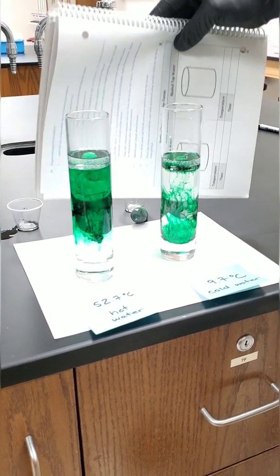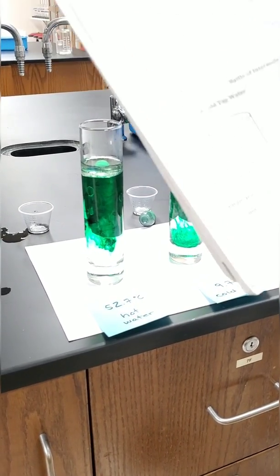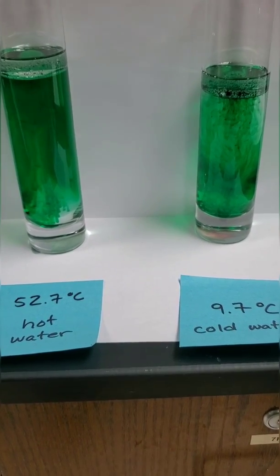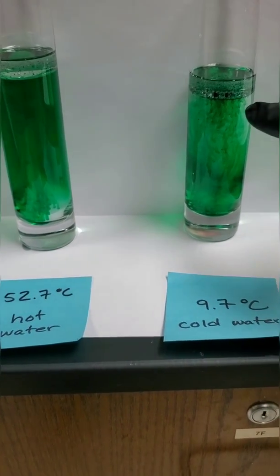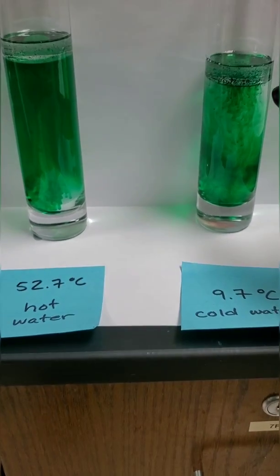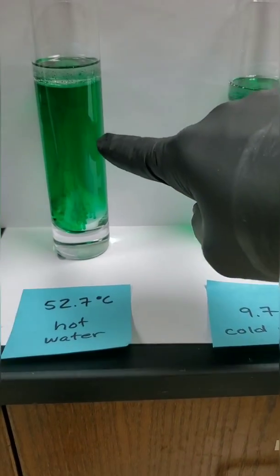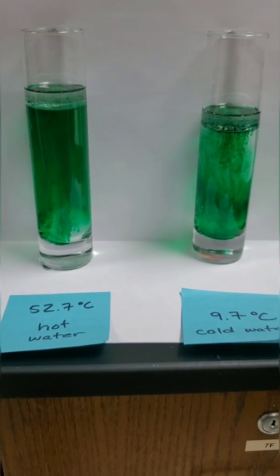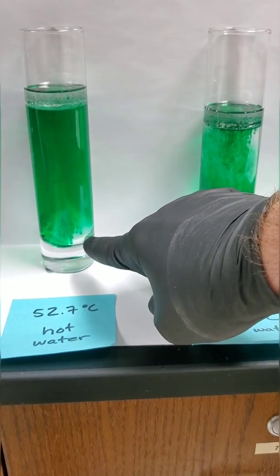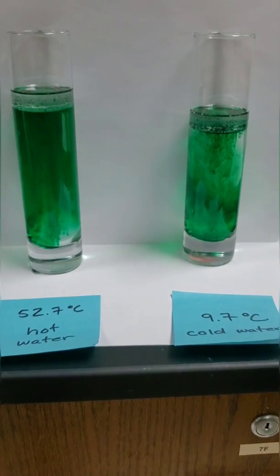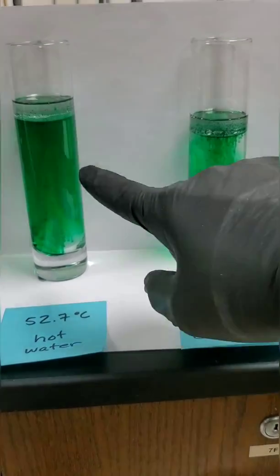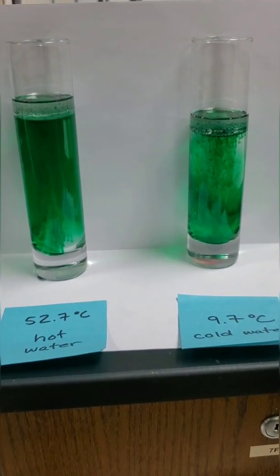And that's what we're sketching in, as well as recording time in our lab book. So notice this one, almost like a jellyfish. Those molecules moving so slow because the attractions are so strong. Over here, it's pretty much green Kool-Aid already. Notice almost all completely mixed. The only part that's going slow is the part that's cold then at the bottom. So as these continue to pop, we're going to time it. And in this lab, other than cleaning up some dishes, is just about over.